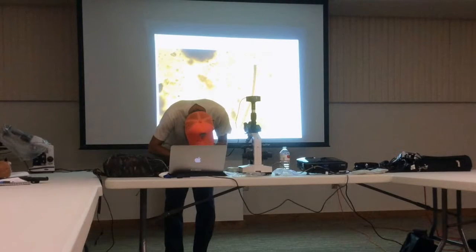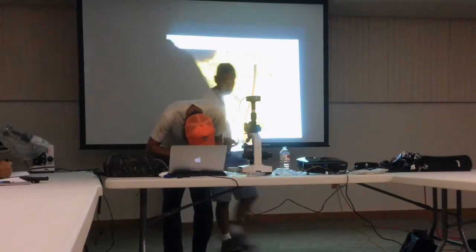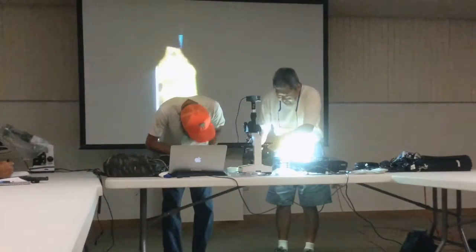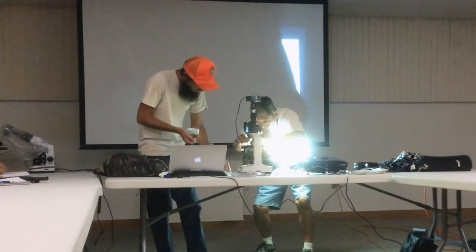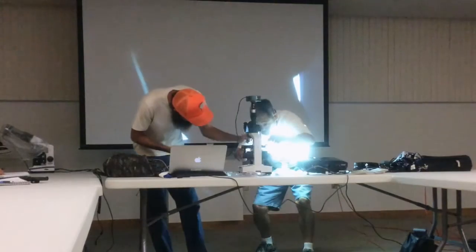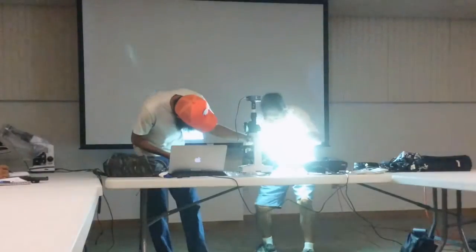You done with that slide? Yeah. Looking for a clean cover slip that's not shattered. Or you can lower it, so there's more space.